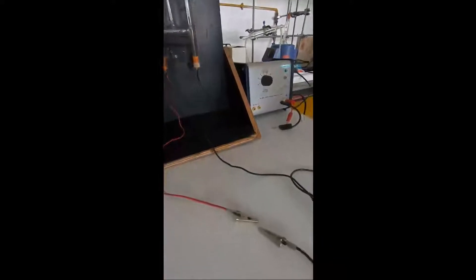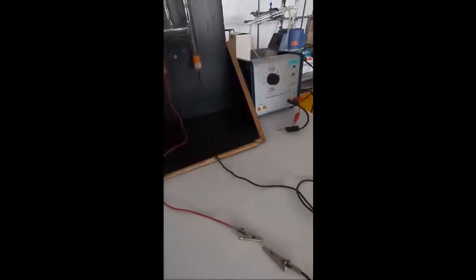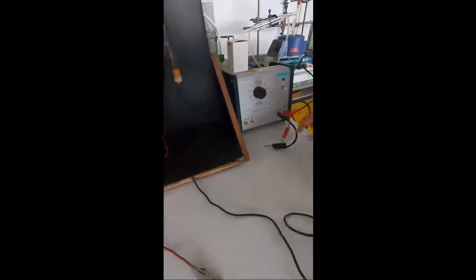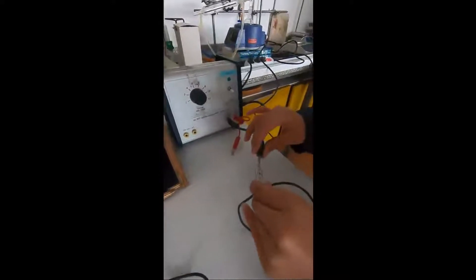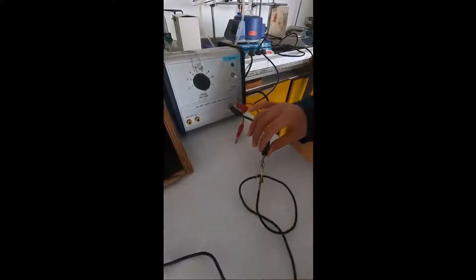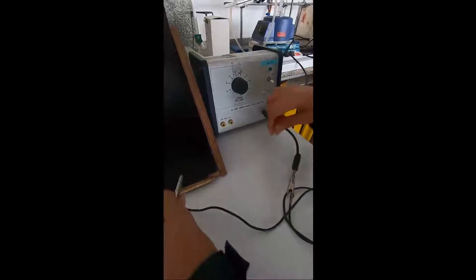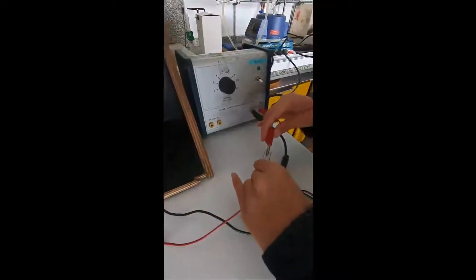Let's switch it on and see what happens. To do that we need to connect the wires. The black one needs to be connected to the black, and the red one to the red—red being positive and the black being negative.